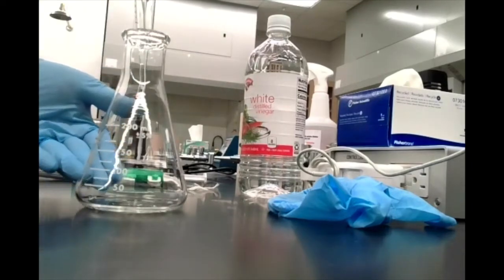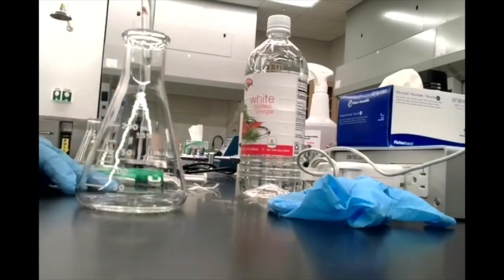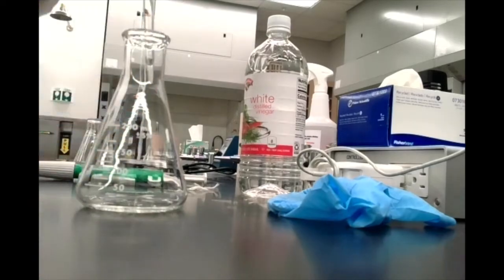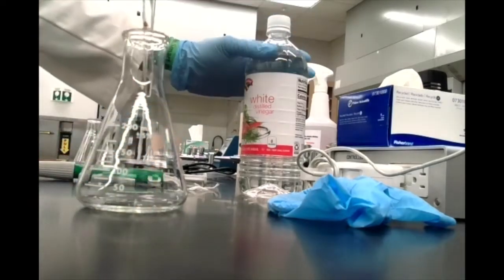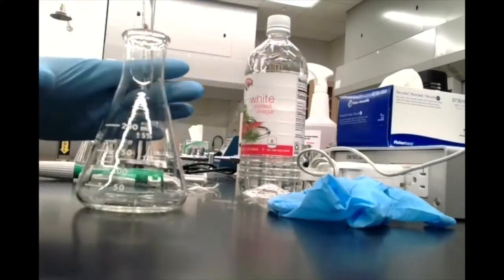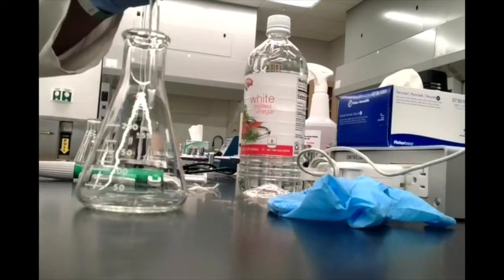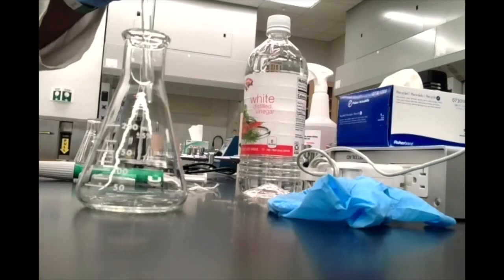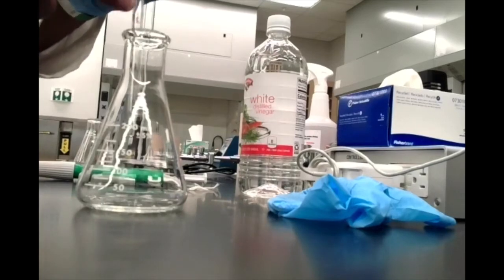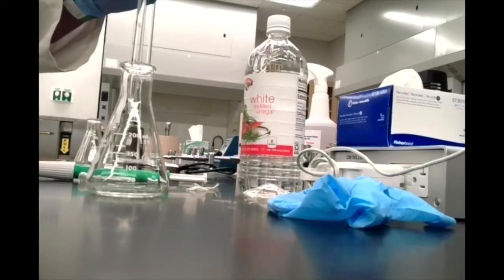That will increase the volume, and so sometimes it makes it a little bit easier to see a reading. It's not really necessary to do that. The important thing is that you have enough. You have 5 milliliters of your original stock of vinegar in this Erlenmeyer. Adding water to this will dilute the concentration, but since you're basing your calculations off the vinegar that you measured here, adding that extra water actually doesn't affect your calculations.